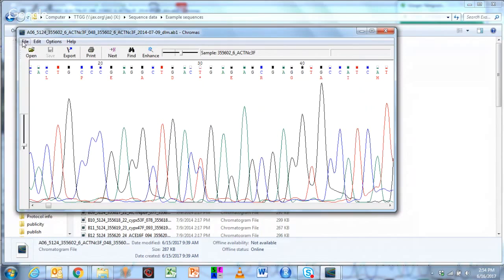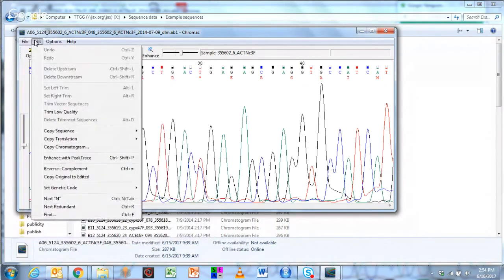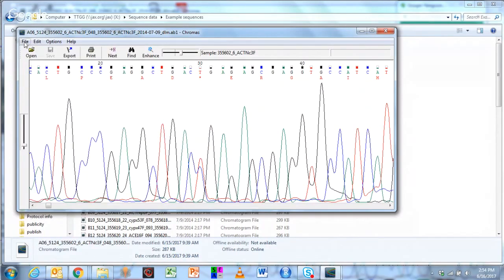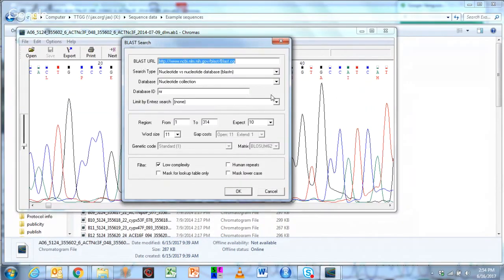We're going to BLAST this sequence, but before we do that, I'm going to copy the sequence so I can use it for something, and I'm going to copy it in FASTA format like that. Then I'm going to go back and BLAST this just to make sure this is actually a human sequence. If you hit BLAST, it'll submit a job directly to the database. So it's talking to your browser. Hit OK here. You're doing it against just nucleotides. You don't need to change anything here.